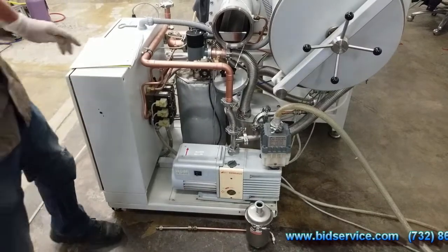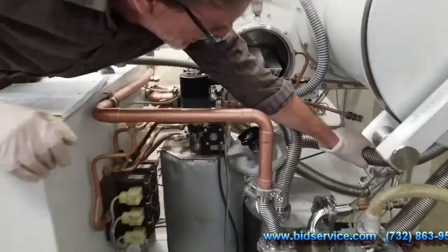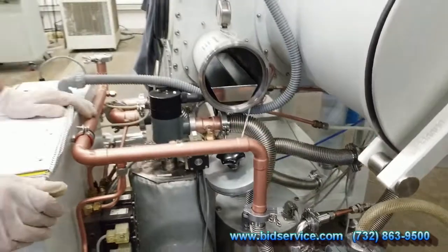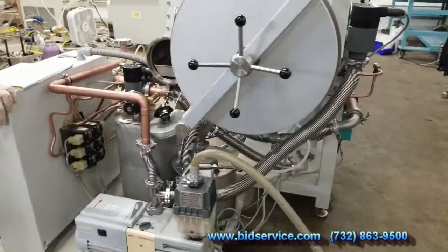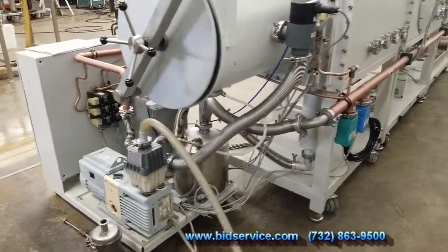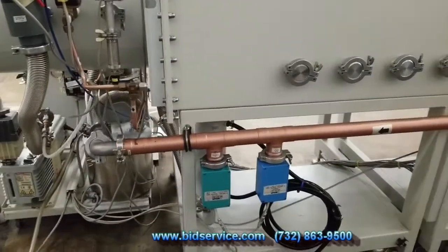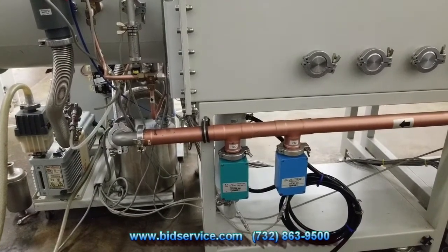The other changes I had to do is I had to add some additional flex line on for our ins and outs of our purifier system. So I extended them. All the cabling fit, extended perfectly. Just have to pull some out of the box. If you can look in the back here, what I did is I rotated the oxygen and moisture monitor sensors to a position like that.